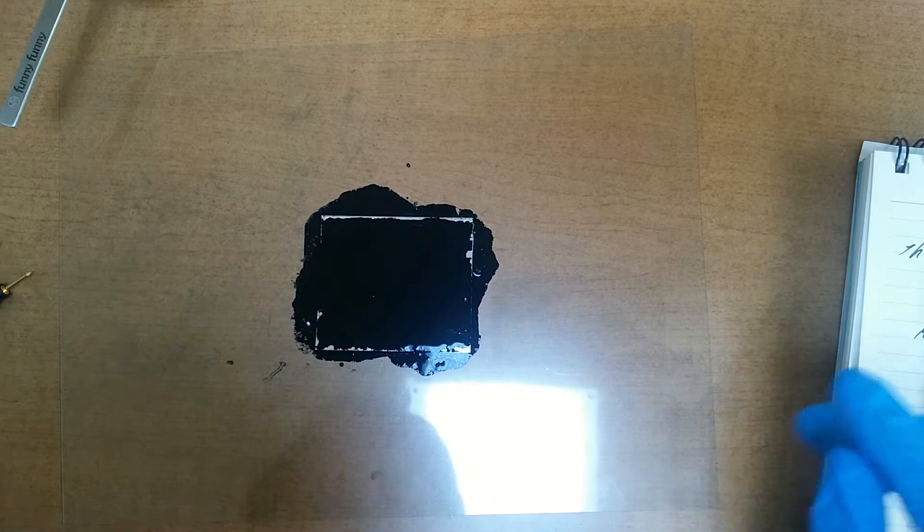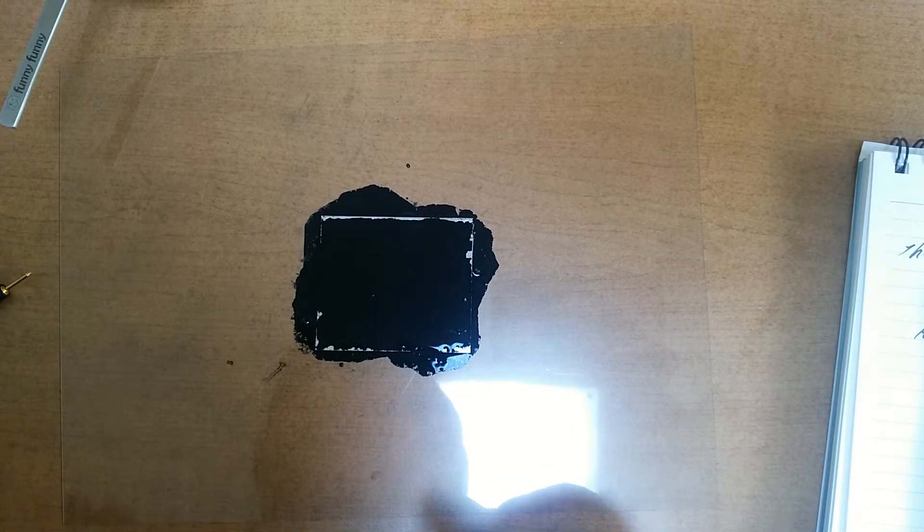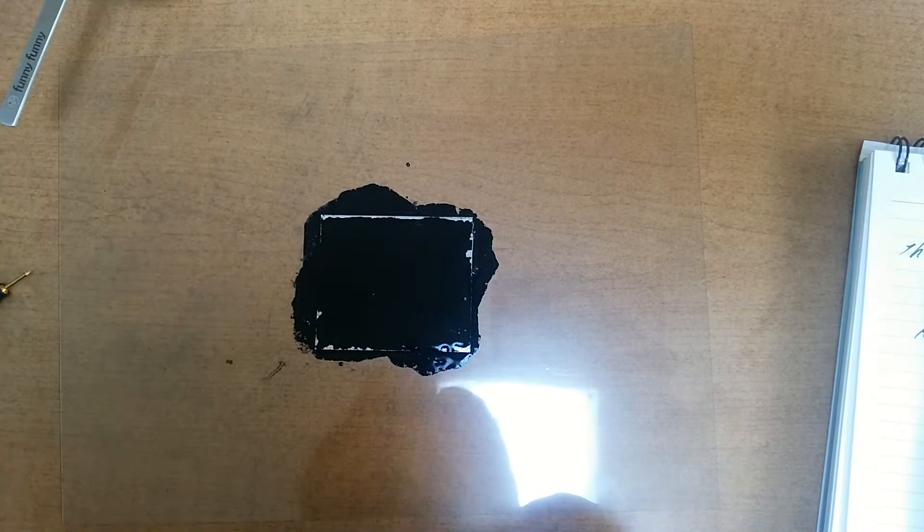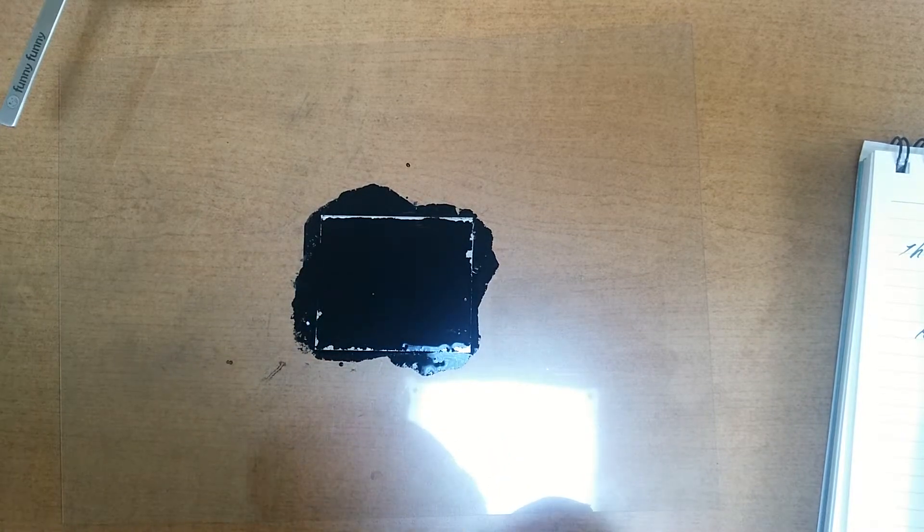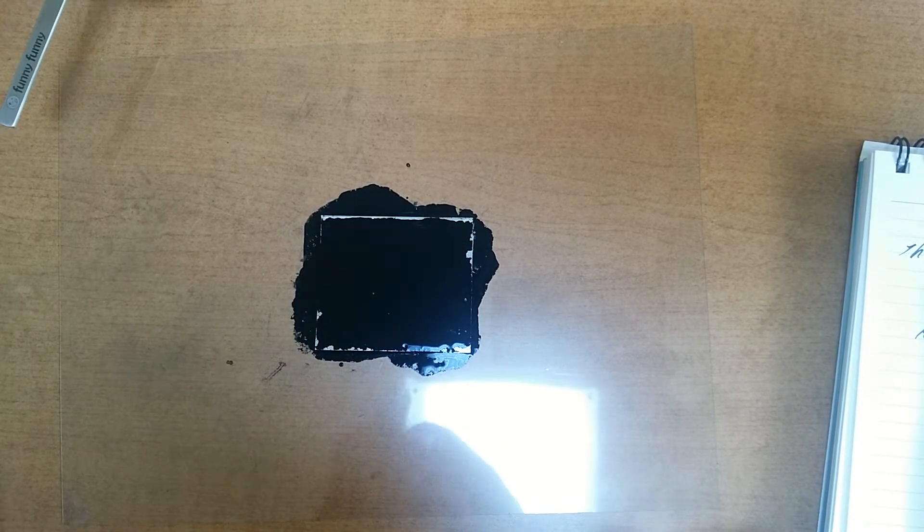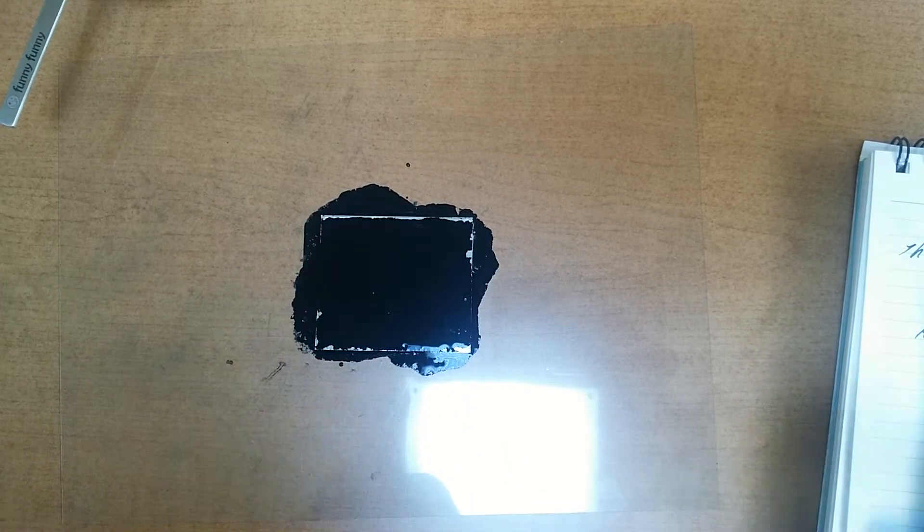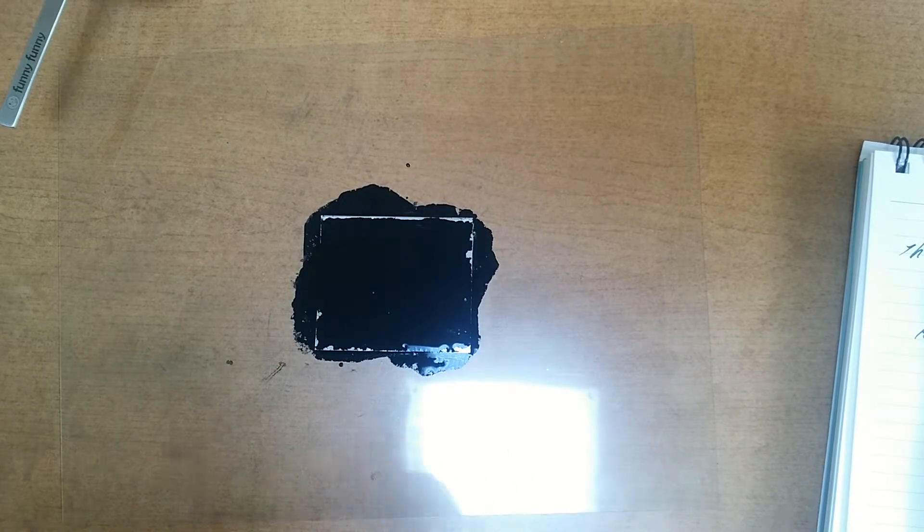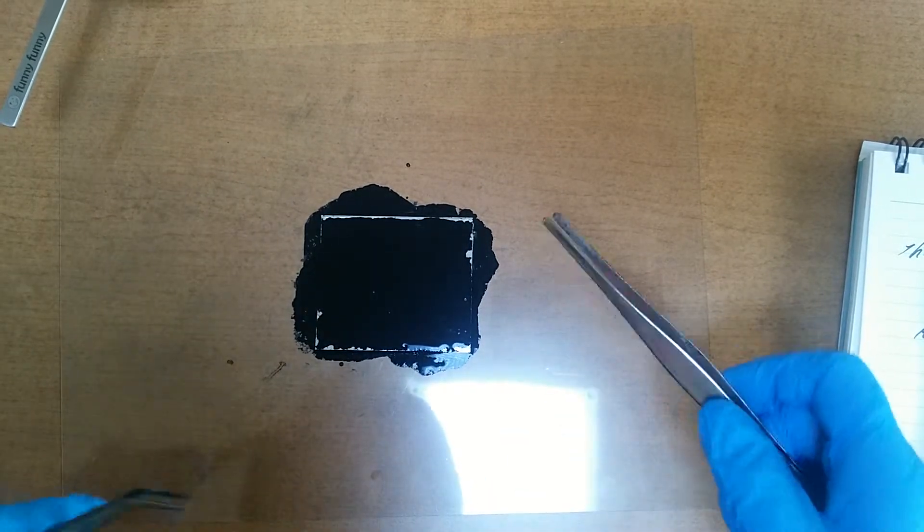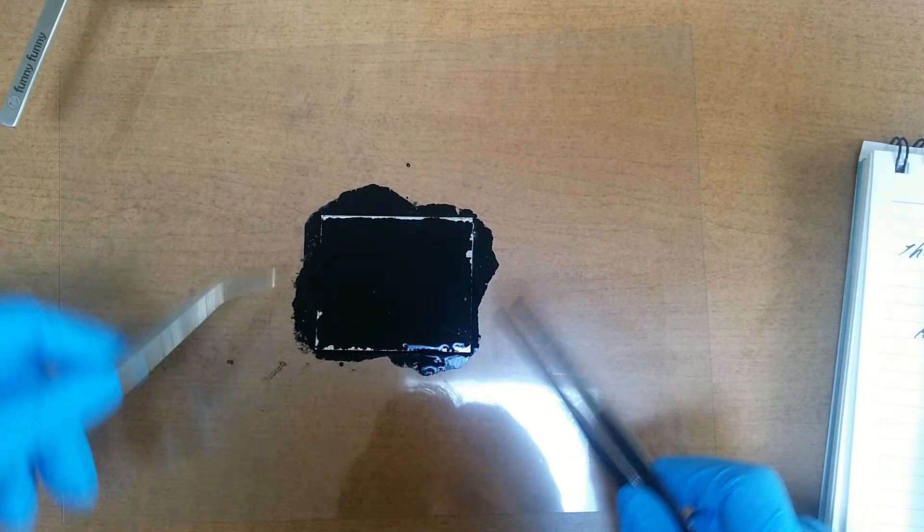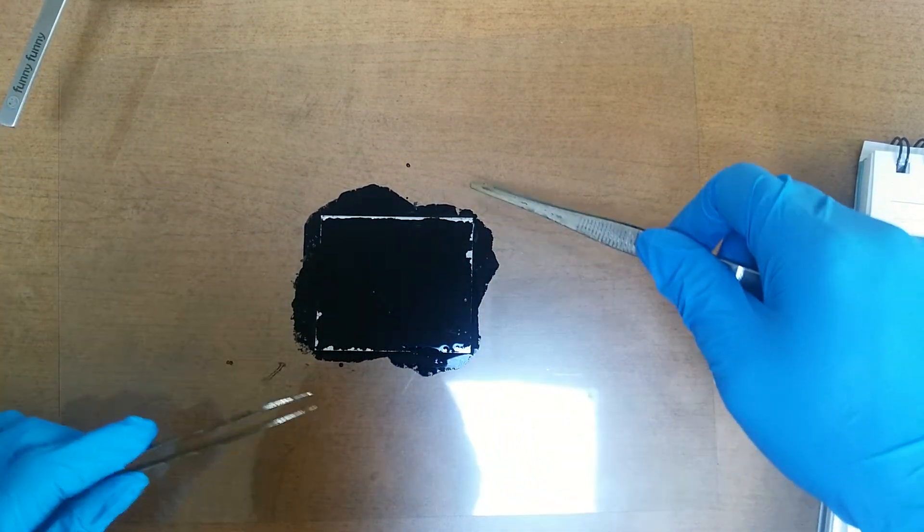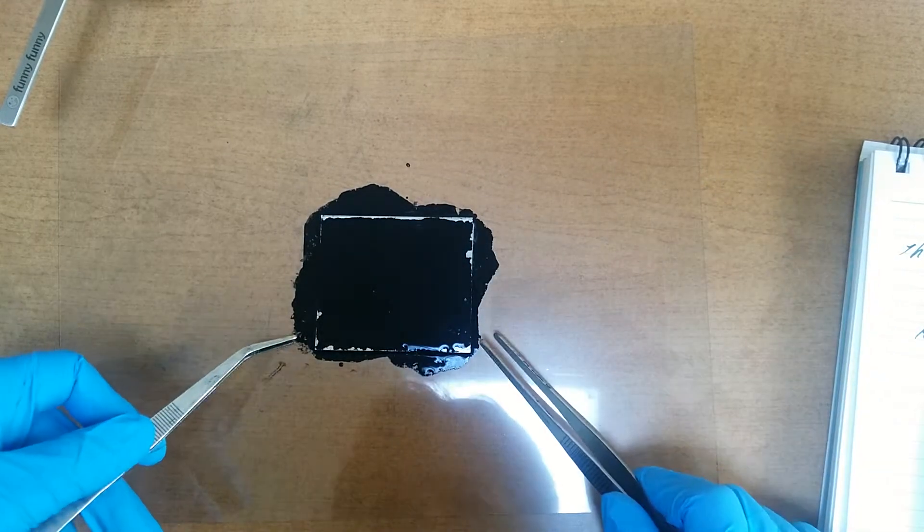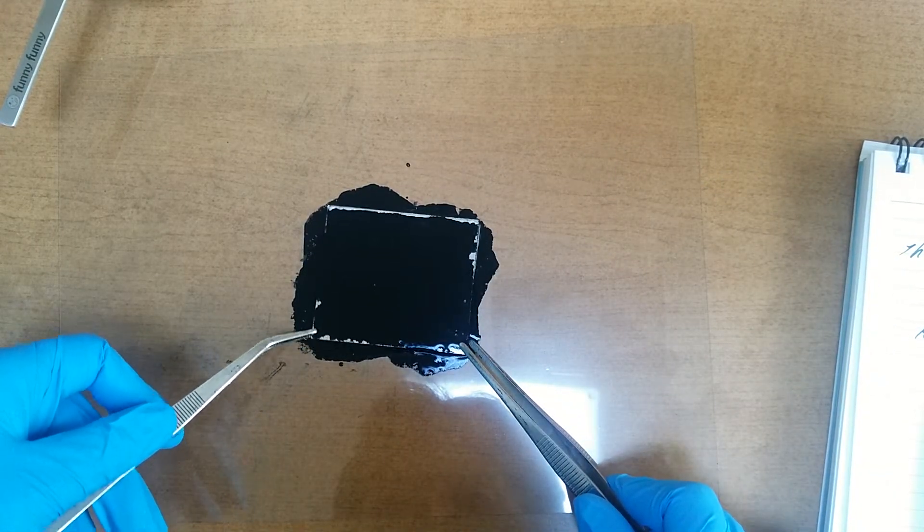I'm sorry, I have a cold. I got a cold. Okay, let's heat this aluminum plate by fire. Let's make it dry.